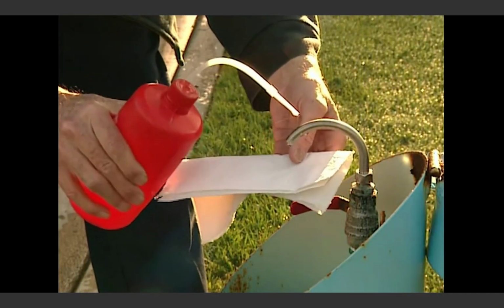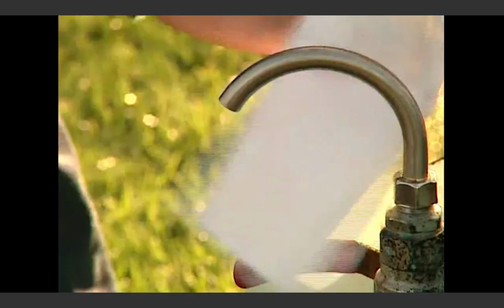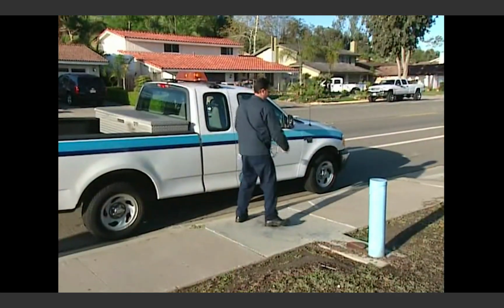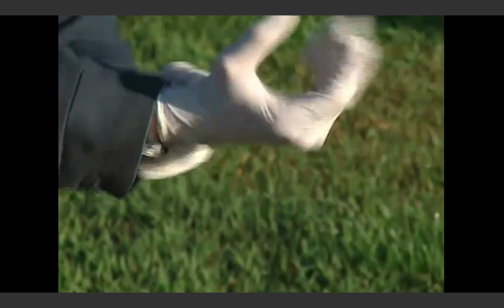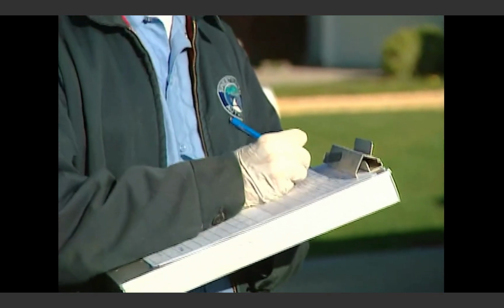Some water utilities use alcohol or a chlorine solution or wipes to clean faucets before or between uses. These methods are not always necessary if the sampling site and tap are properly selected and maintained. Paying close attention to details is the key to good sampling technique. Keep records of any unusual observations at time of sampling.